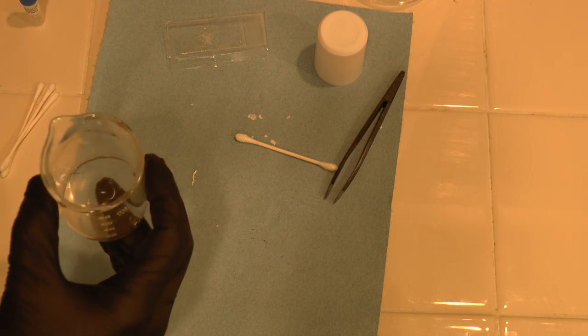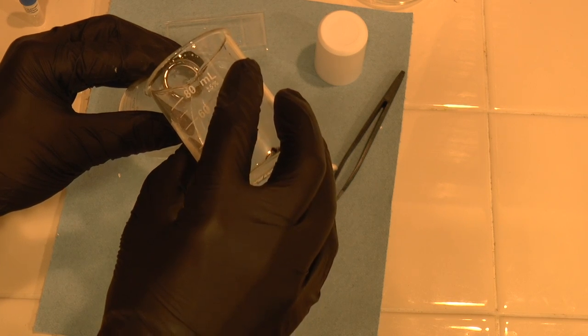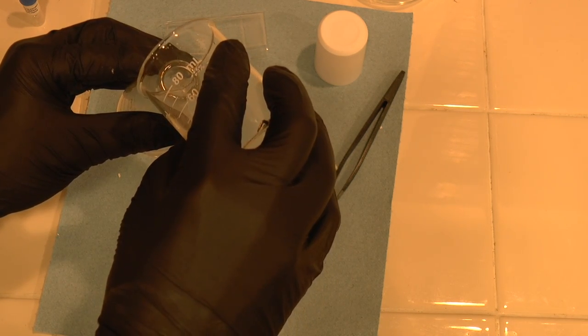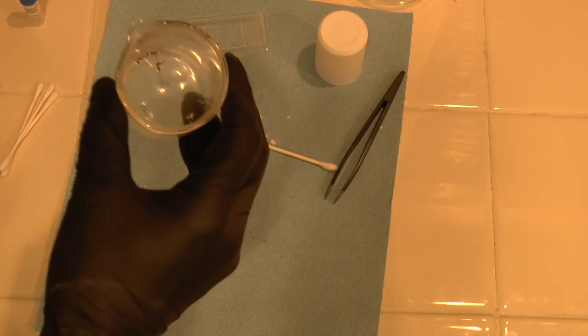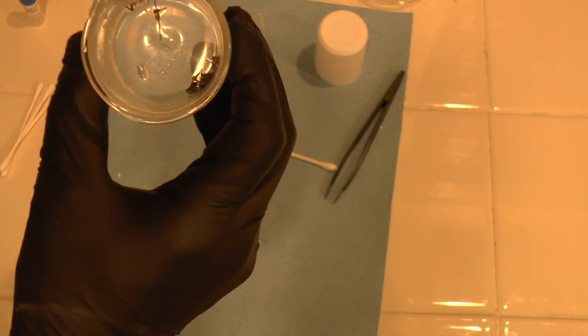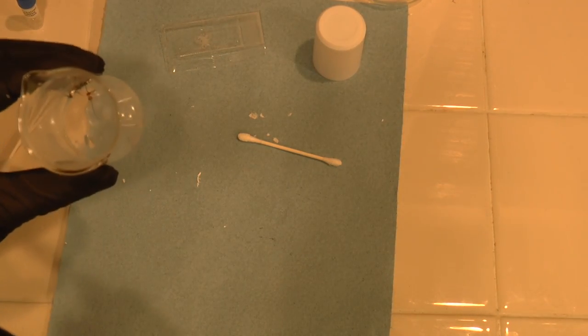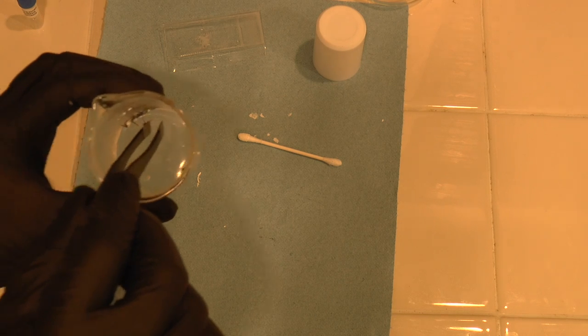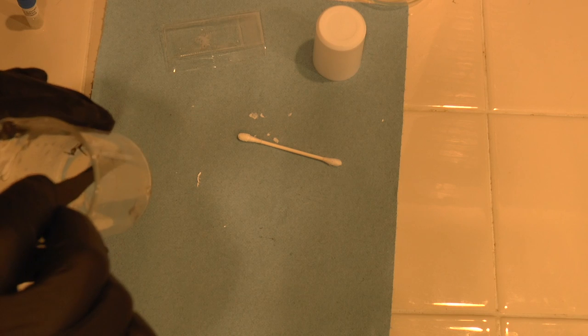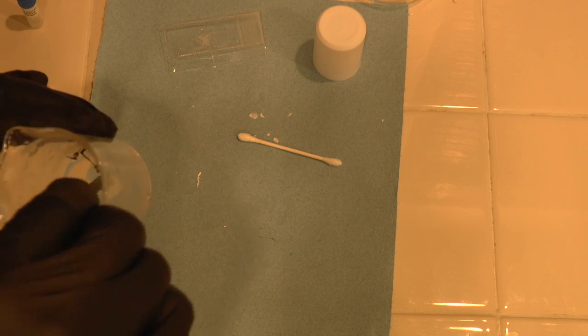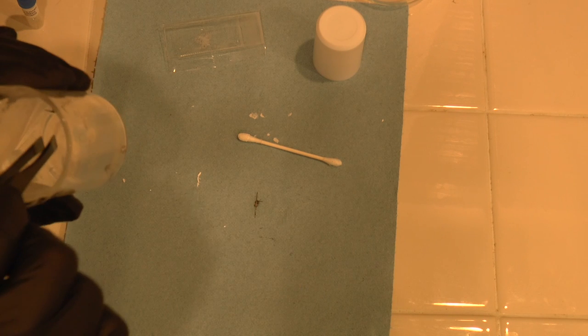Let's see what I can see. I am pouring off the water first so that all I have left is a little bit of wet stuff in there. I'm going to take some tweezers. These aren't metal tweezers, these are just plastic tweezers. I'm going to locate the die and pull it out. It's actually attached to a little bit of lead frame. But it's there.